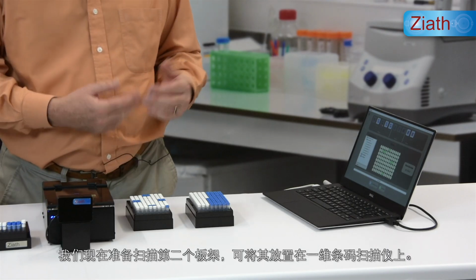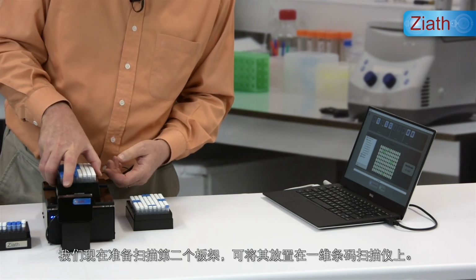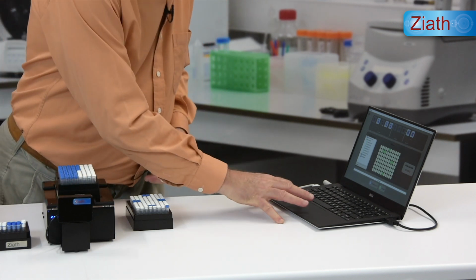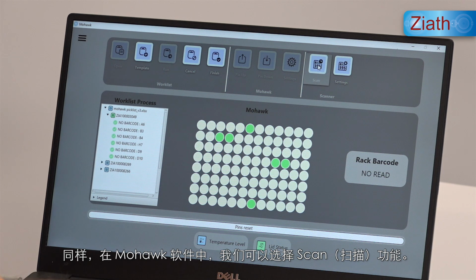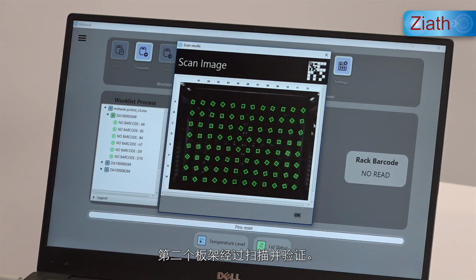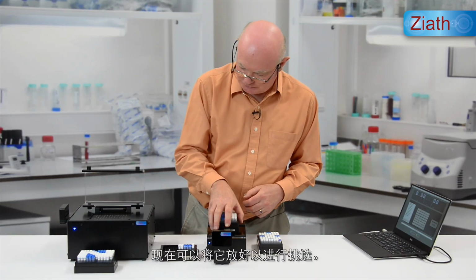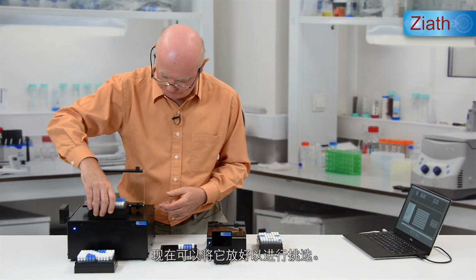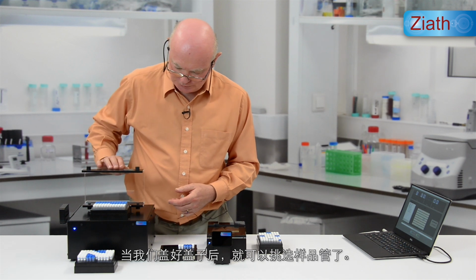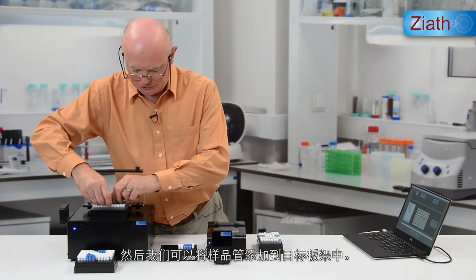We're now ready to scan the second rack, which can be placed onto the linear scanner. Again, from within the Mohawk software, we can key the scan function. The second rack is scanned and verified, and it can now be placed for picking. When we close the lid, the tubes will be picked. We can add them to the destination rack.